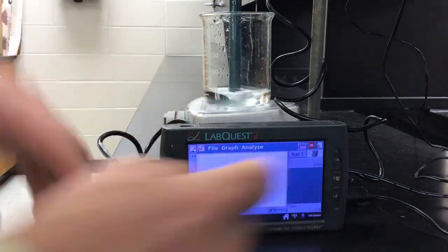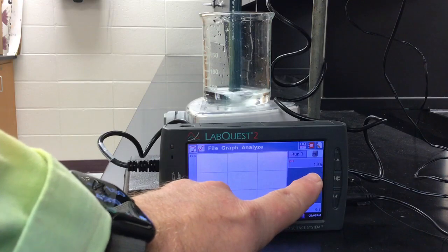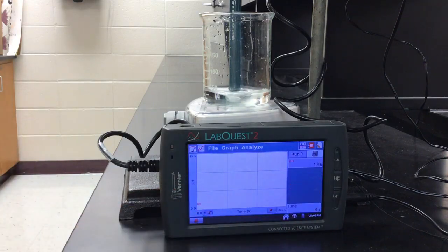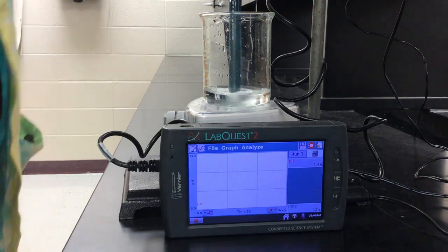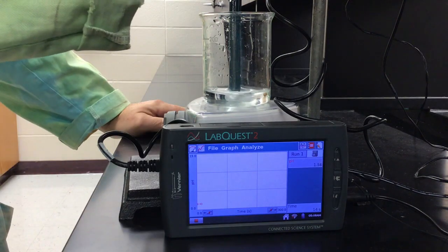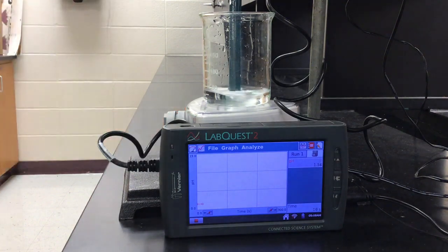And so we're going to take readings. The readings are over here on the right-hand side. So we're at about 1.55 as our pH. And it's going to increase as I add the base to the solution. So I'm going to lower the burette down here. And I'm going to add consistently until I get that pale pink color. So I'm just adding it drop-wise there. You can see it dripping into solution. And it'll take a little while before it goes pink. But we're going to keep an eye on that pH as it's rising as I add more base to this weak acid solution.